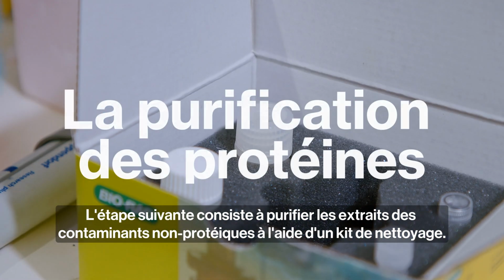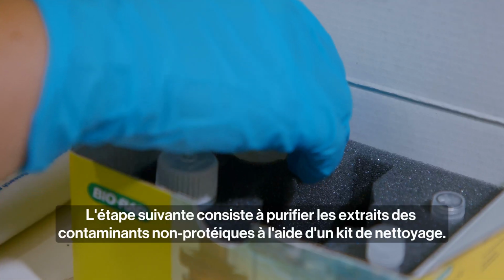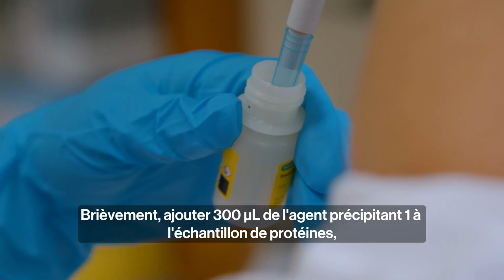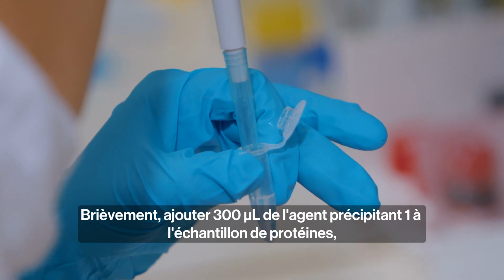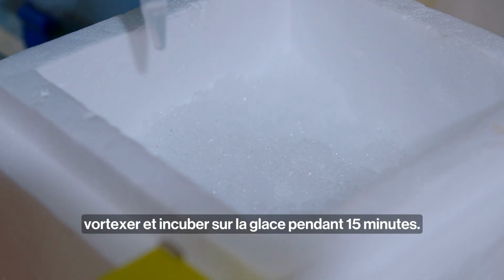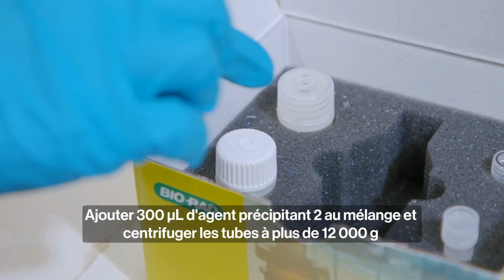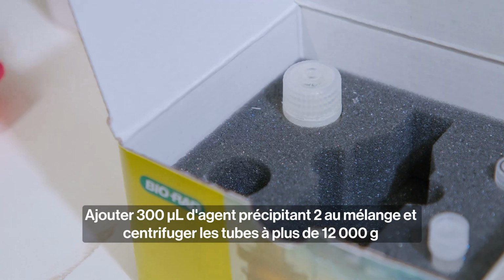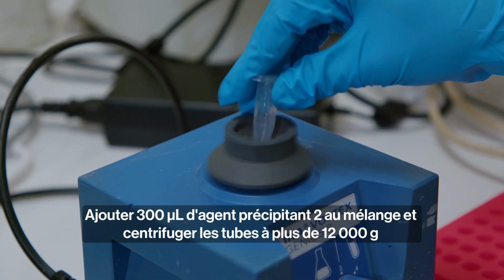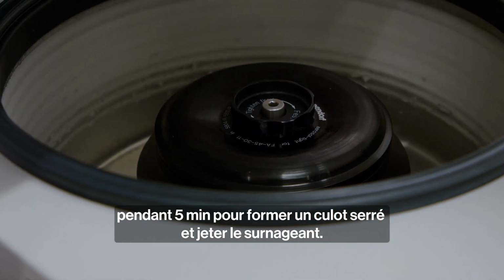The next step is to purify the extracts of non-protein contaminants using a cleanup kit. Briefly, add 300 microliters of the precipitating agent 1 to the protein sample, vortex and incubate on ice for 15 minutes. Add 300 microliters of precipitating agent 2 to the mixture and centrifuge the tubes at more than 12,000 Gs for 5 minutes to form a tight pellet and discard the supernatant.